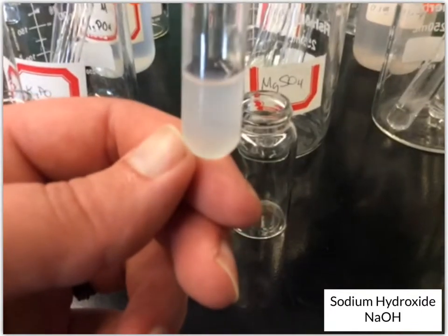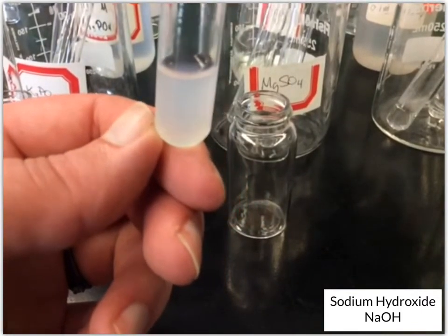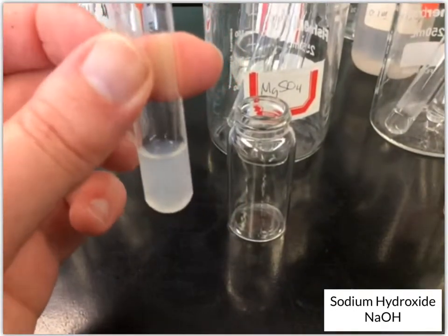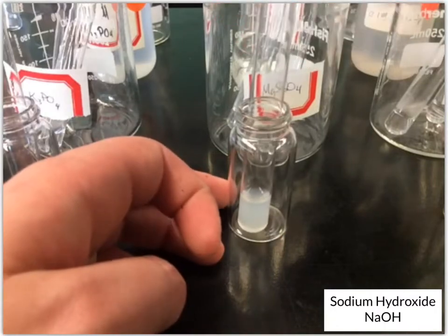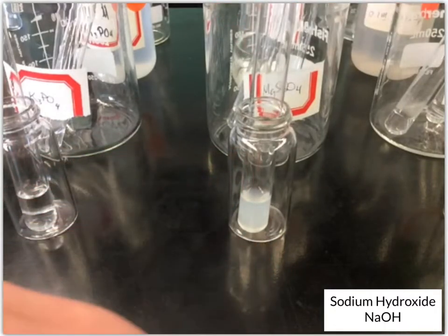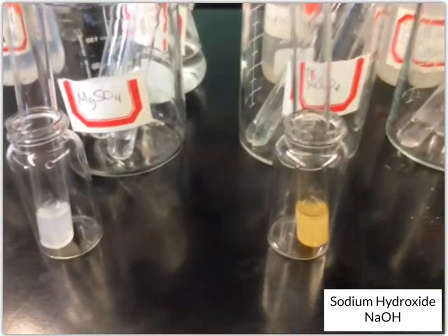It hasn't settled much, but we haven't given it as much time as the others. Okay, it looks like it's really slow to settle, but we've got that cloudiness in there, so something got formed.